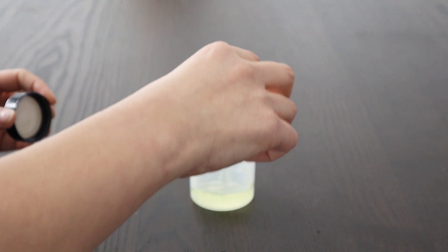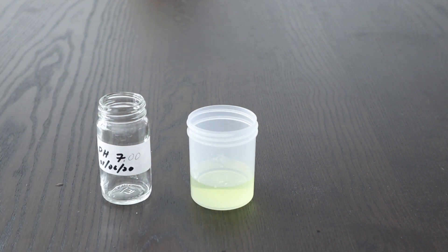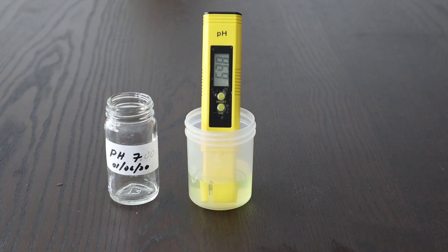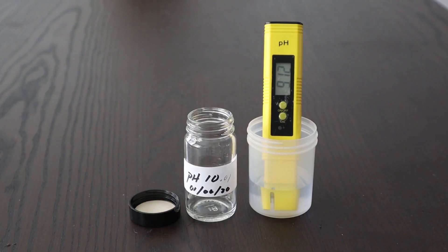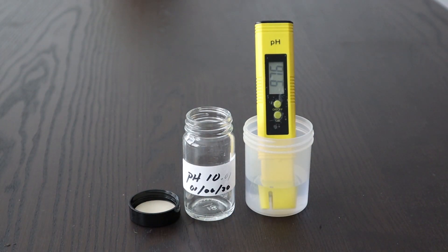So let's go back and see how accurate my pH meter is now. I'm going to pour out the pH standard solution of 7 once again, and hopefully it should read 7 this time. I put my meter in and — yeah, it got 7. I also have other pH standards, so I'm going to pour a solution of 4 and see if it reads 4. It looks like we got 4. And I also have one for a pH of 10 — it looks like it got 9.78. It's close, but not quite.